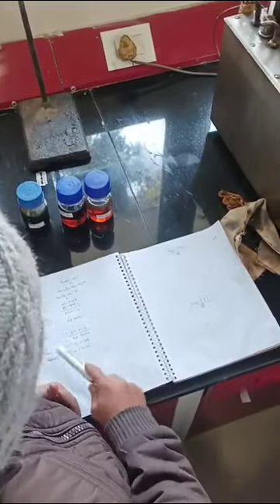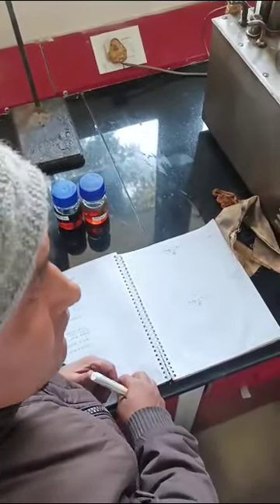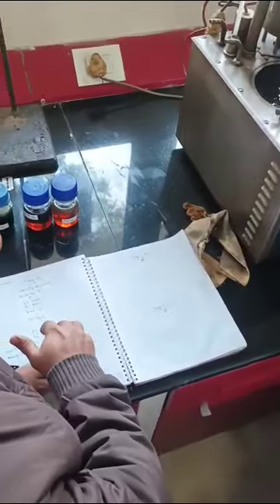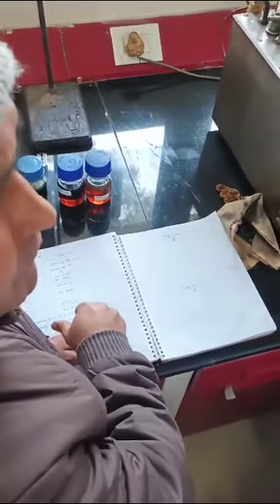The density is 62.5, this much. Now you can convert the density to 15 degrees, because we have a density conversion book. From there you can convert to 15 degrees centigrade, and we will report the density at 15 degrees centigrade. Why are we reporting the density at 15 degrees centigrade?